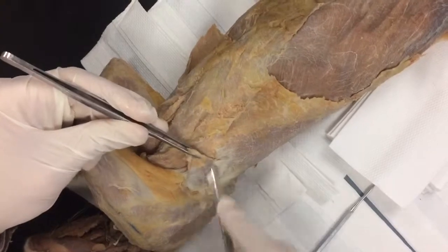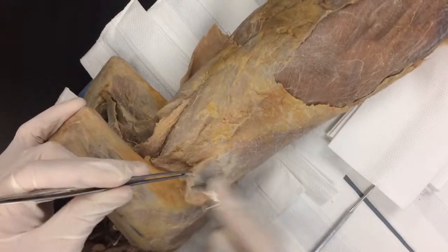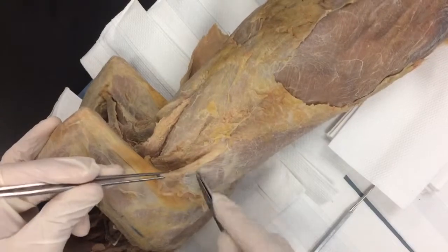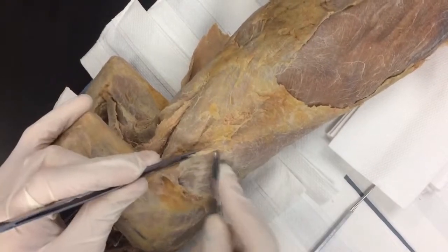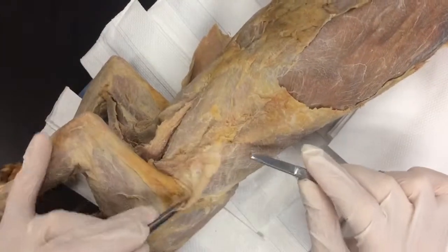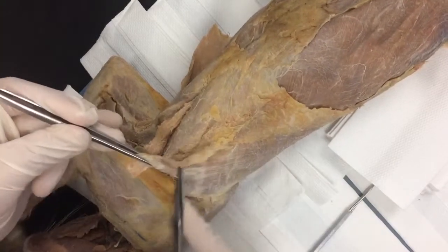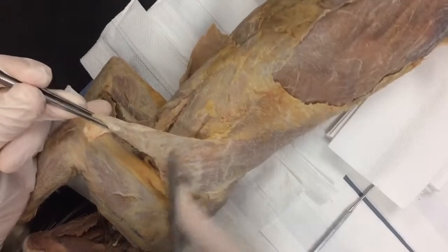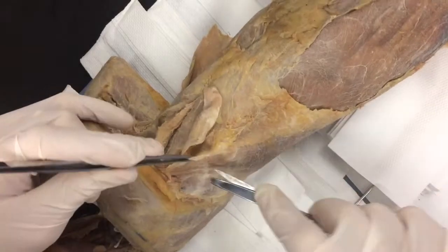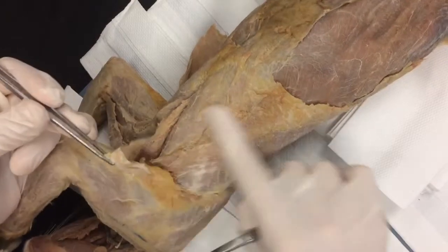It's going to make you nervous, but that's the muscle we want right there. When I pull this up, you can see the connective tissue gets real white. I'm just scraping with my scissors and I'm going to remove this layer of muscle. That's the tissue we want underneath. This is going to come right into pectoralis minor, and it's going to be pretty tight, so I'm just going to keep working it until it just flakes off by itself. We don't want to get this all chewy, though.